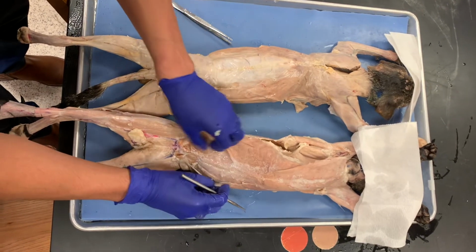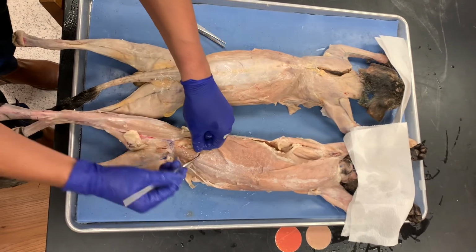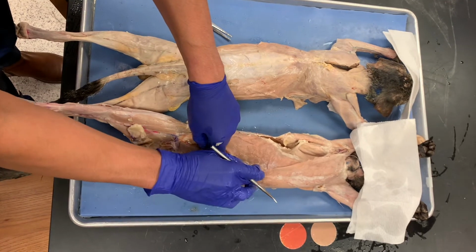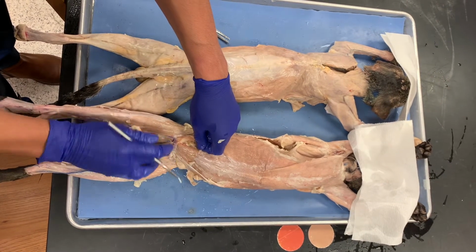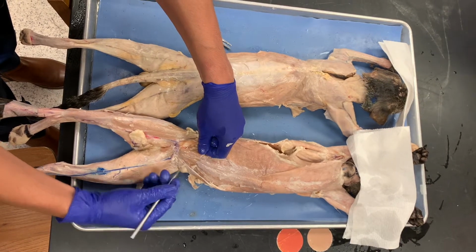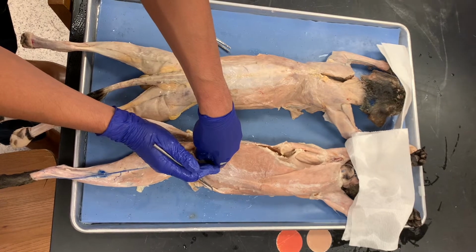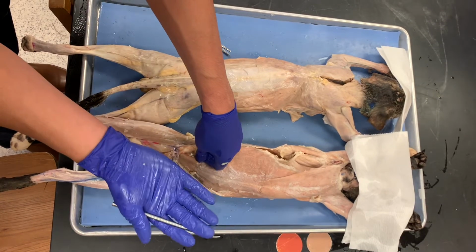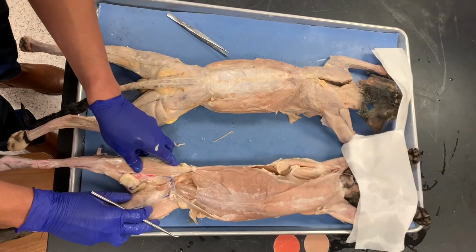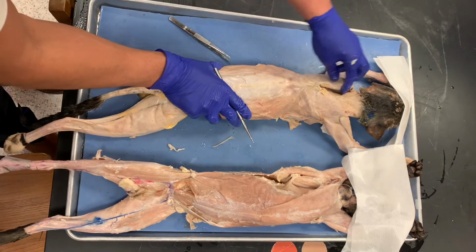And then if we look here towards the distal attachment, this is the rectus abdominis, right? It starts here at the xiphoid and goes all the way down here to the pubis region, but you can see the striations going downward. So it's rectus, right, because the striations are straight, and then it's in the abdomen. So rectus abdominis is there. So that's for the thorax.